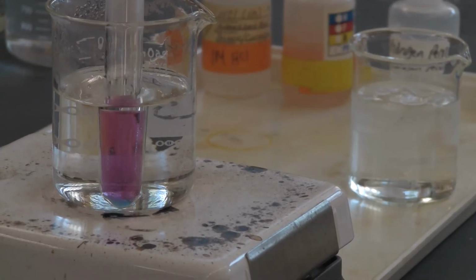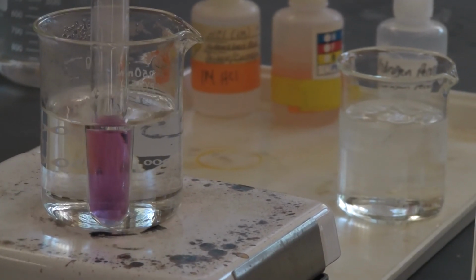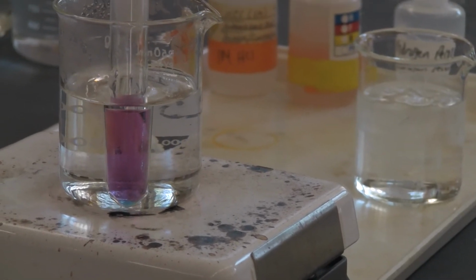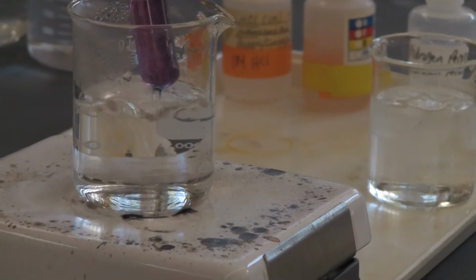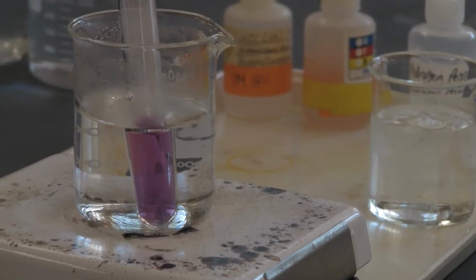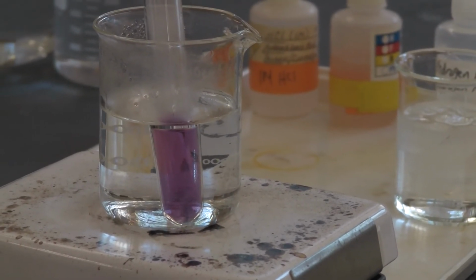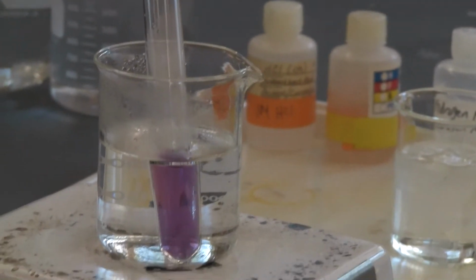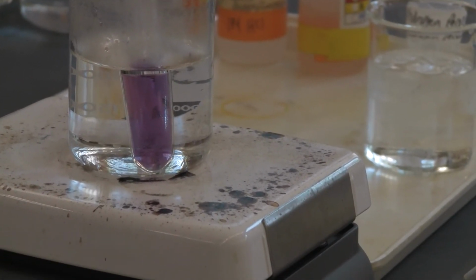It's no longer pink, it's purplish. And also don't forget the factor here is that I'm heating it. So give it some time. Whoa, the color is more and more blue now. By looking at the shifting, decide the shifting, then you need to figure out whether this reaction is endothermic or exothermic, and also use this to explain why it happened that way.